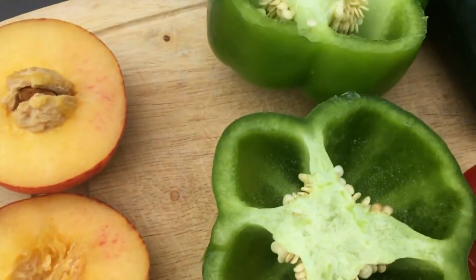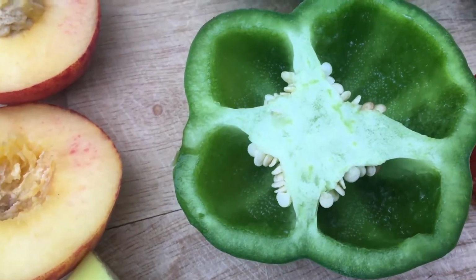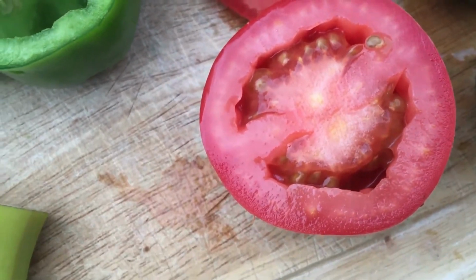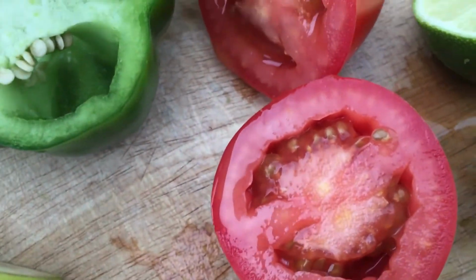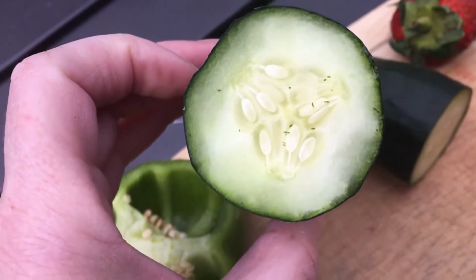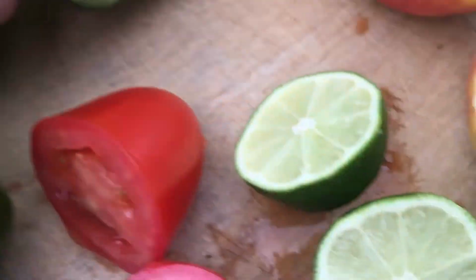We've also got green peppers, another kind of berry. You see the seeds inside there, a little less fleshy tissue. But tomato, also a berry with the seeds inside, many seeds. And then we have those modified types of berries like a pepo, which has a thicker leathery rind. Cantaloupe, watermelon, pumpkin, all of those would also be pepo.